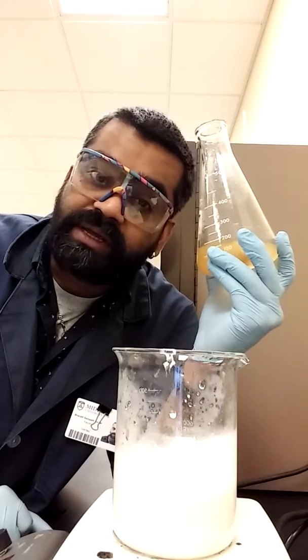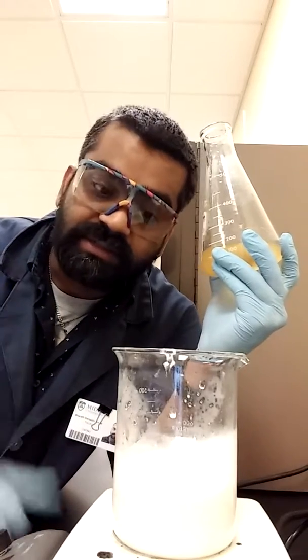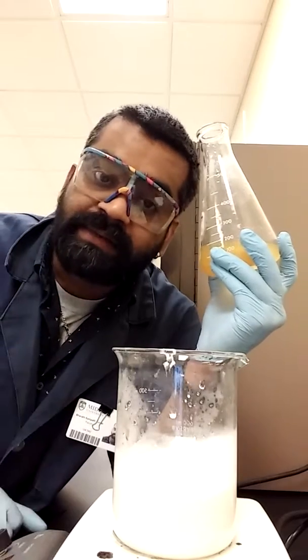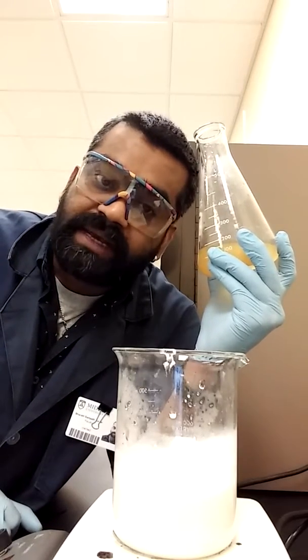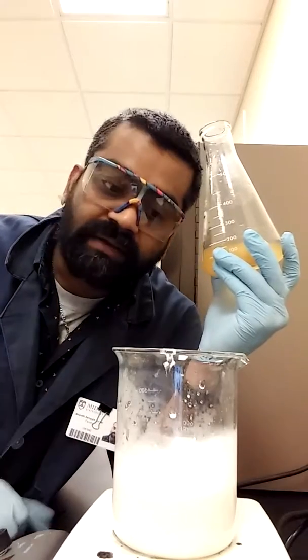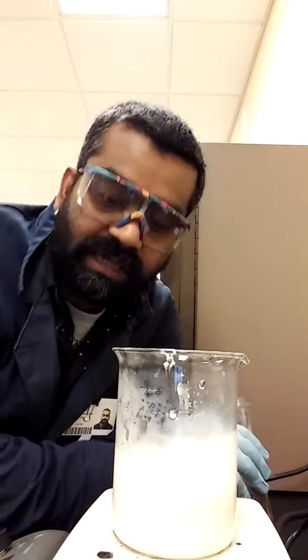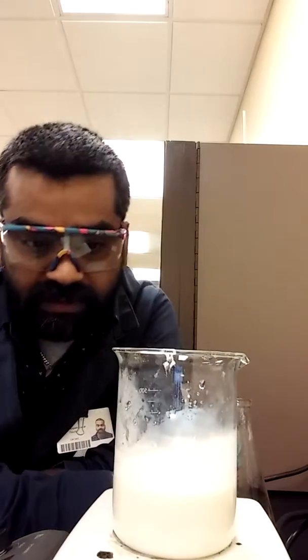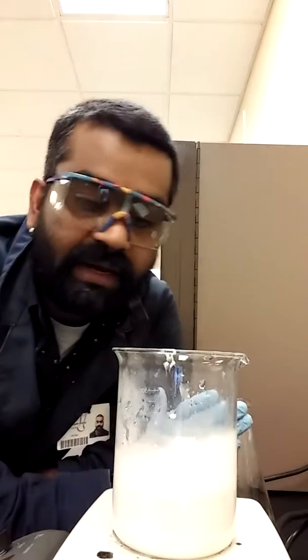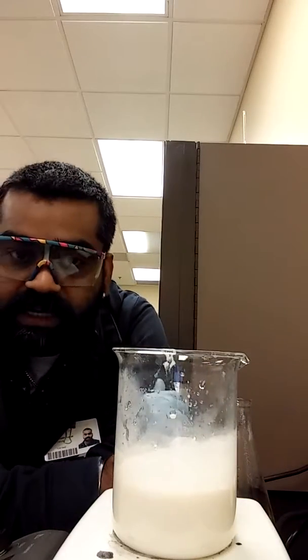If you feel there's some impurity, you can always recrystallize it and then recrystallize it, recrystallize it until you see a really, really clean looking citric acid. But again, that is something we can do. I think I've done a good job already. So there's not going to be as much impurity in the sample. It looks pretty clean to me. There's no coloration of any kind. It looks pretty good. So that's step four.